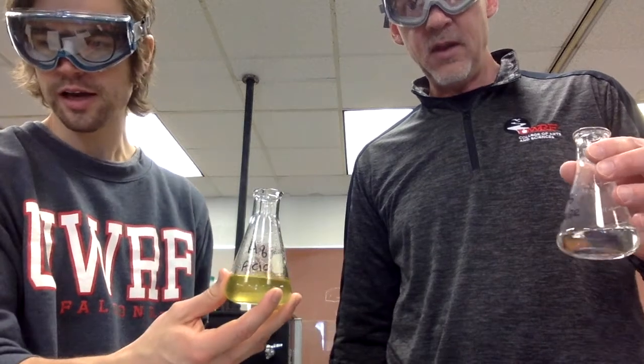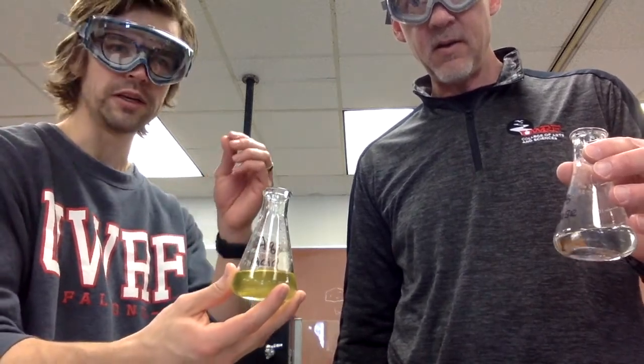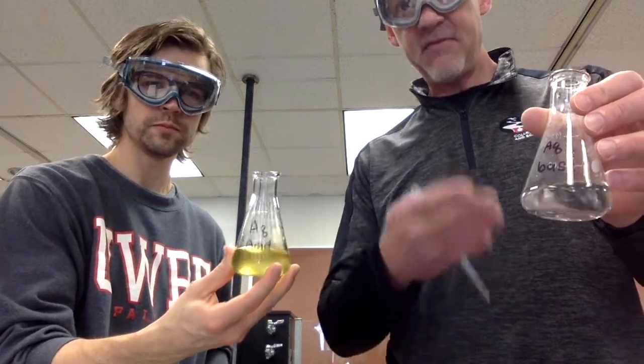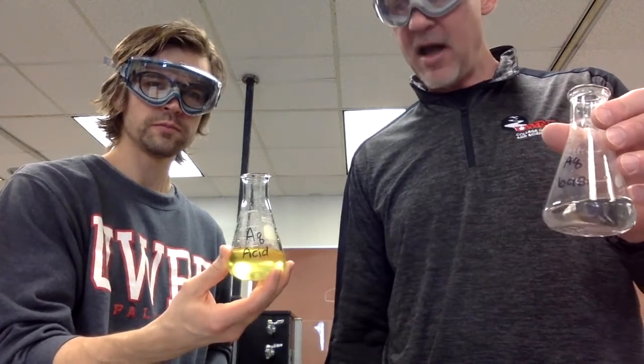Yep. Now we are adding about 5 milliliters of methyl tert-butyl ether to each of these. Yep. And that is what we are ultimately going to be taking a sample from to spot on the TLC plate. That's right. So we've got the aqueous base here that was acidified at 5 milliliters MTBE. Shake it around to let the layers mix, and then we'll be spotting the organic layer onto the TLC plate. And then we'll do likewise with the aqueous acid one that was basified. So it's kind of important to note, it says aqueous acid, but right now, this is basic. We just saw that. So same with that one.